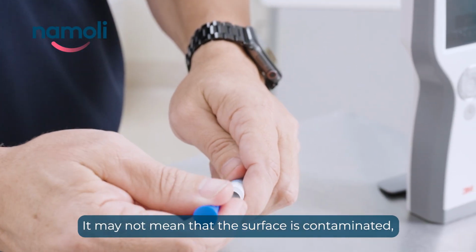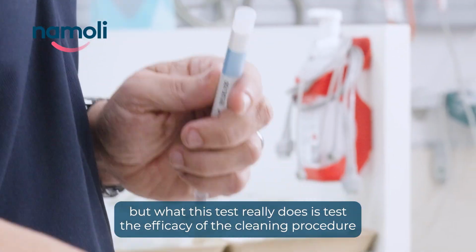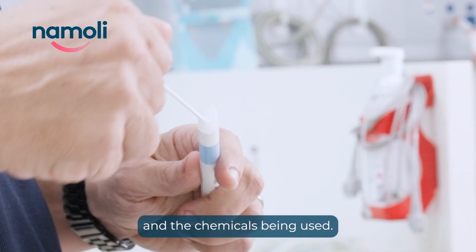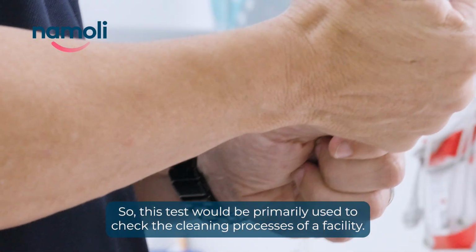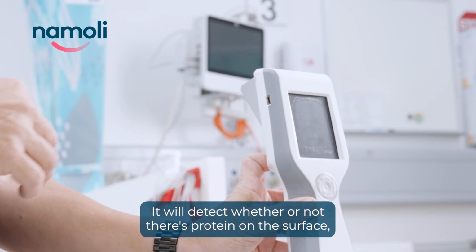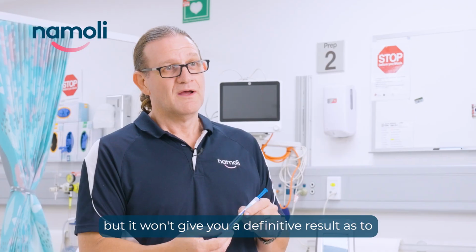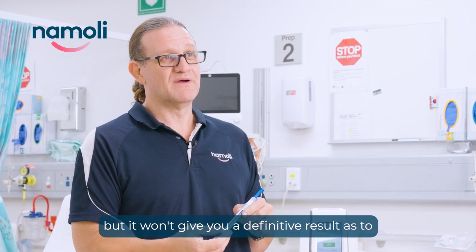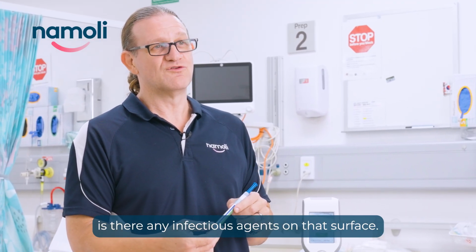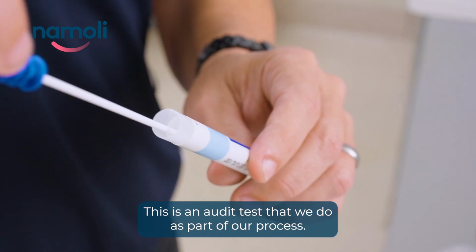It may not mean that the surface is contaminated, but what this test really does is test the efficacy of the cleaning procedure and the chemicals being used. So this test would be primarily used to check the cleaning processes of a facility. It will detect whether or not there's protein on the surface, but it won't give you a definitive result as to is there any infectious agents on that surface. So it's very important to remember that. This is an audit test that we do as part of our process.